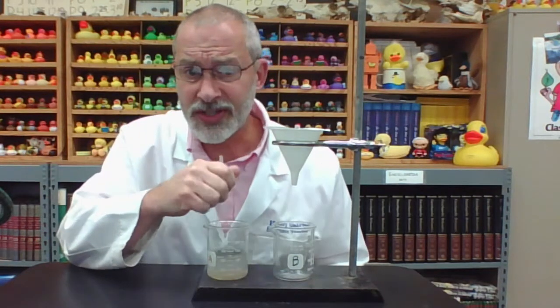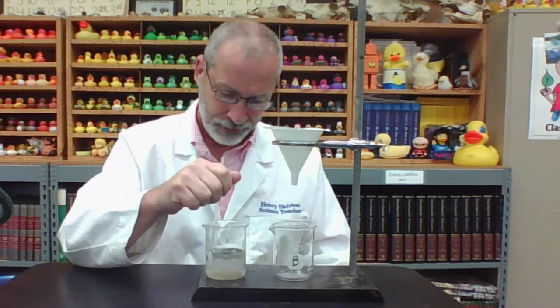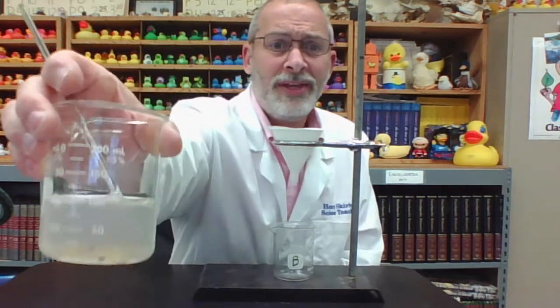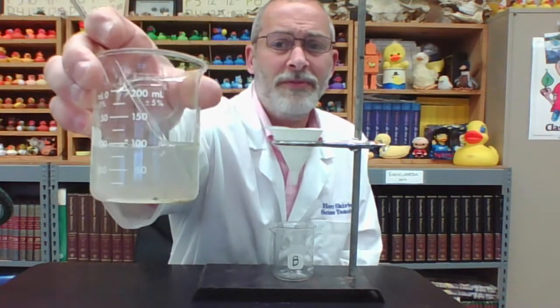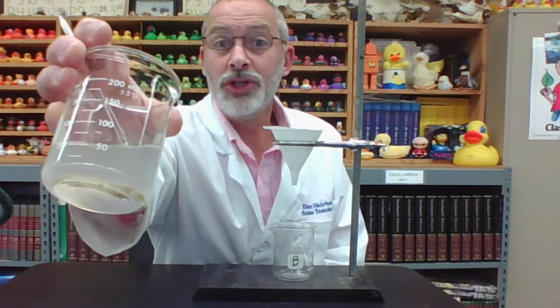As you may be able to see, the sand is not doing the same thing as the salt did. The sand, even though I am trying vigorously to stir with the stirring rod, is not dissolving. And notice the contents, all the sand on the bottom of the beaker has separated very easily from the salt and the water. But feel free to pause the video and note your observations.